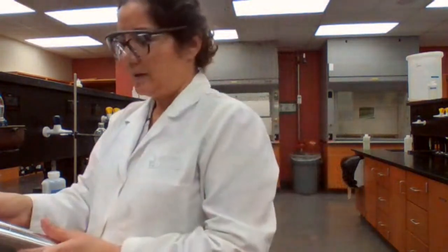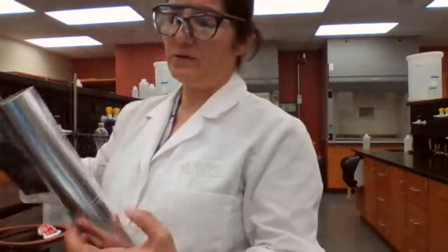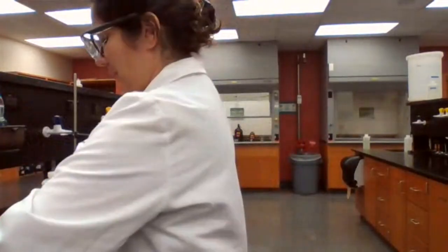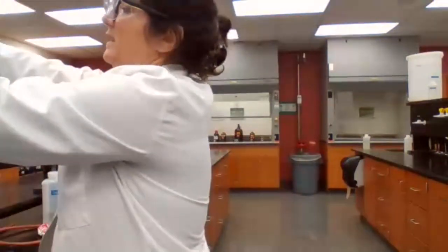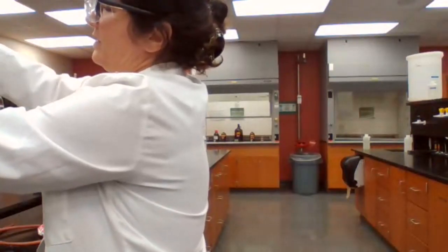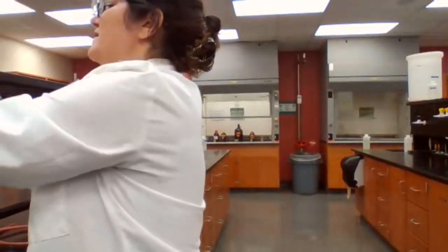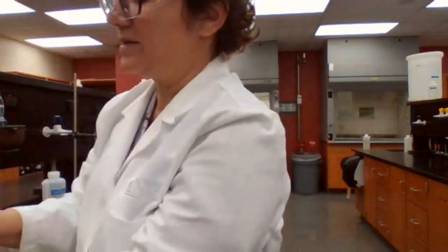Okay. We may not have to use the aluminum foil, but since I never used it before and this is the last distillation for the experiment for the lab, use of aluminum foil sometimes in this area or the fractionating column ensures that if the vapor makes it up here, it's going to transfer to the condenser and it doesn't come back.